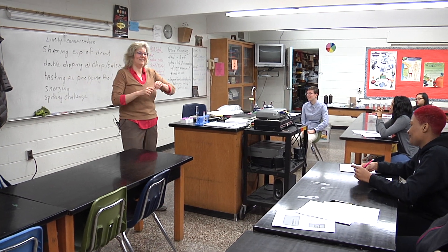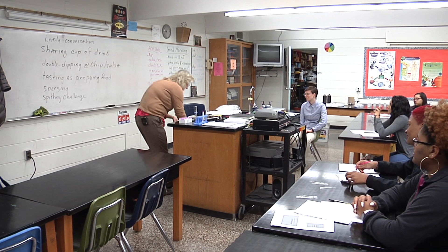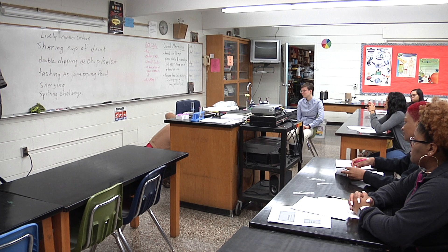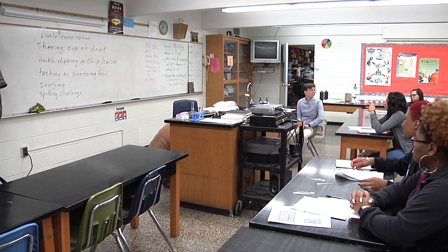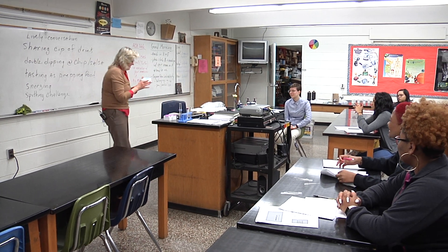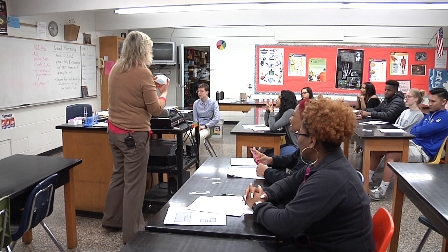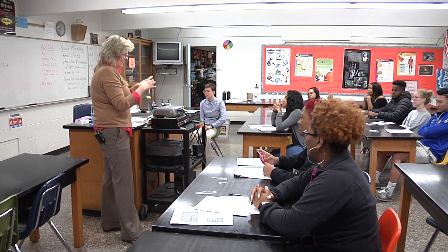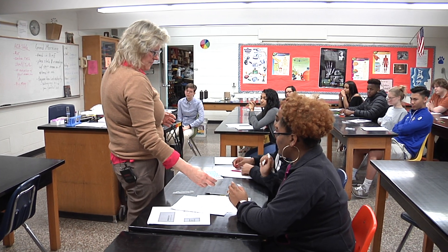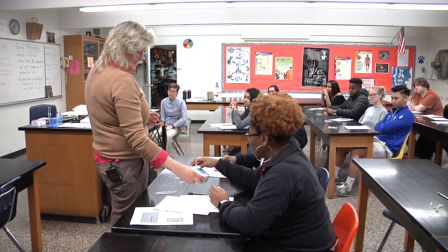So what we're going to do now is each of you are going to take a sample. I'm going to get them out of the fridge here. These samples are going to simulate your saliva, and you can just pick one, anyone you like. They are numbered for a reason — pick whatever one you like.